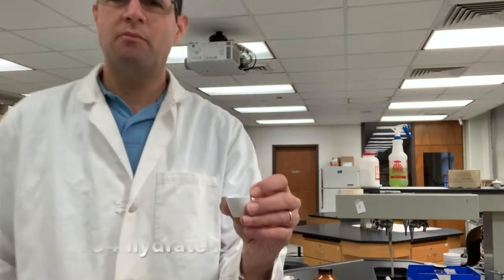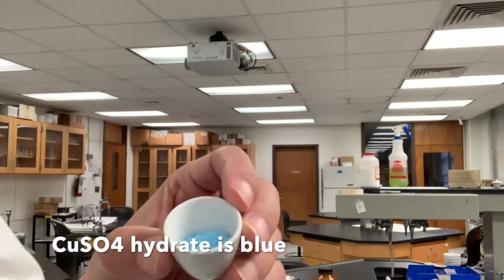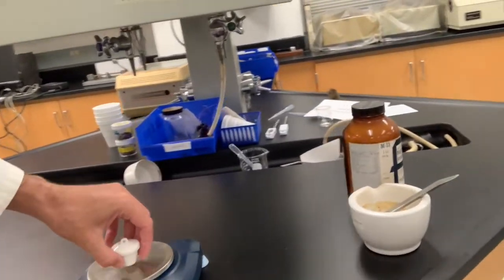So I filled this crucible about halfway up. Let's go ahead and weigh with the lid again. You want to make sure you always weigh the lid and the crucible body.